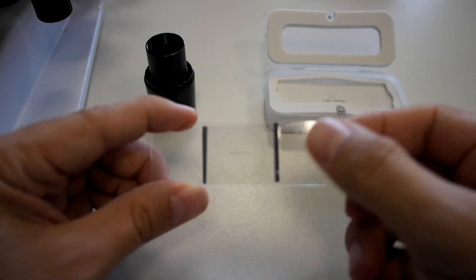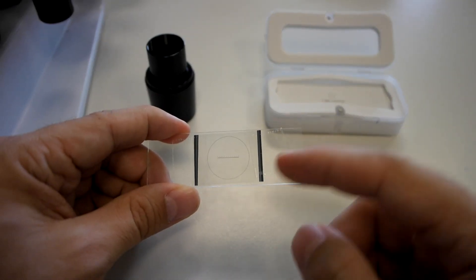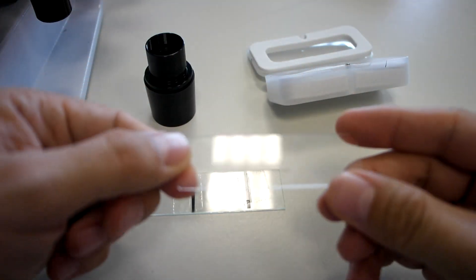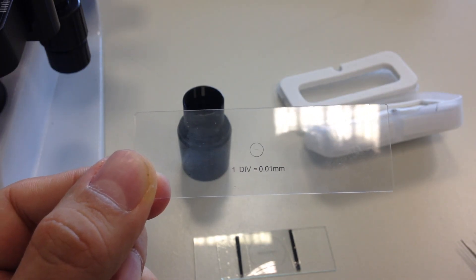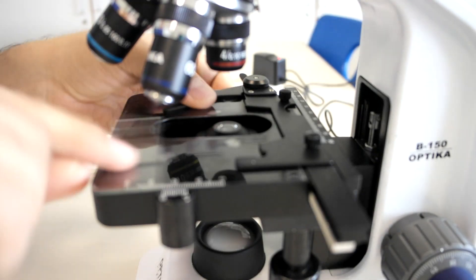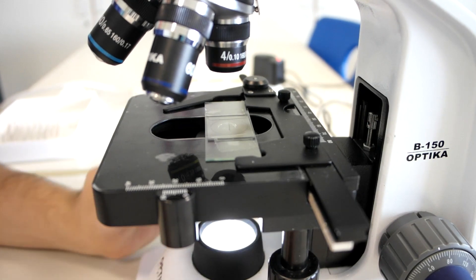This is the plastic version — we just cut the plastic and scratch tape onto the slide. Here is another version, the classic one, quite different from the one that Cambridge sends. Place the stage micrometer on the stage and turn on the microscope.